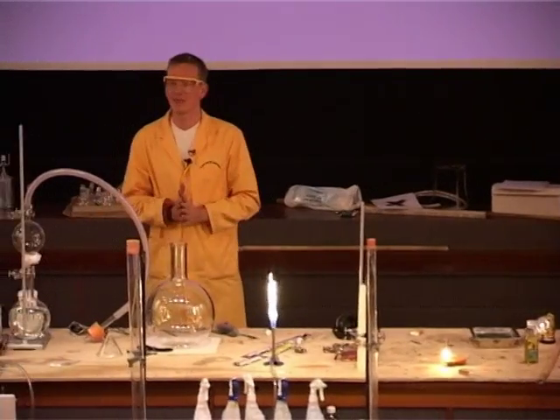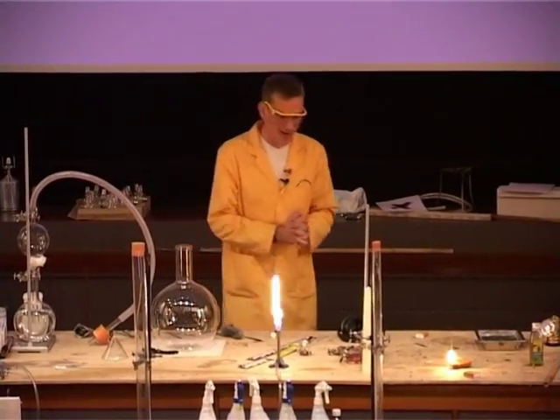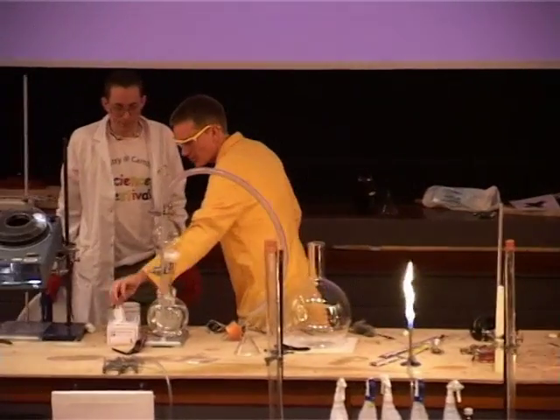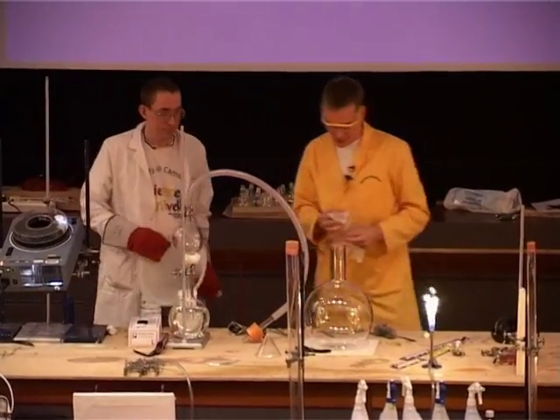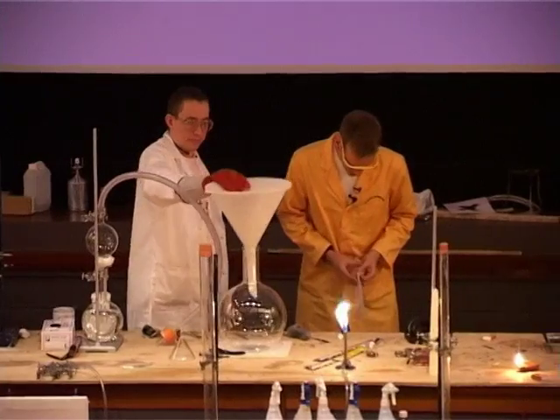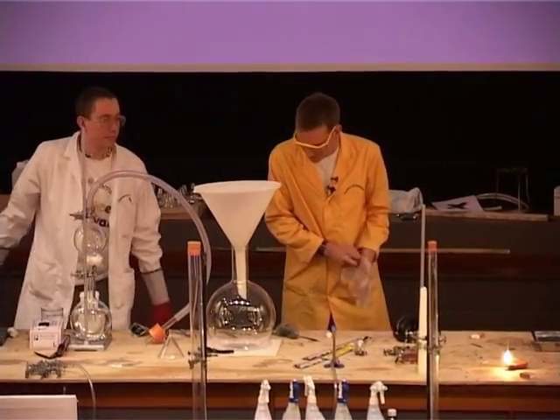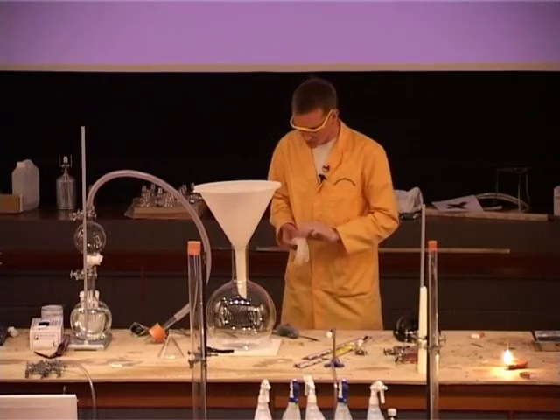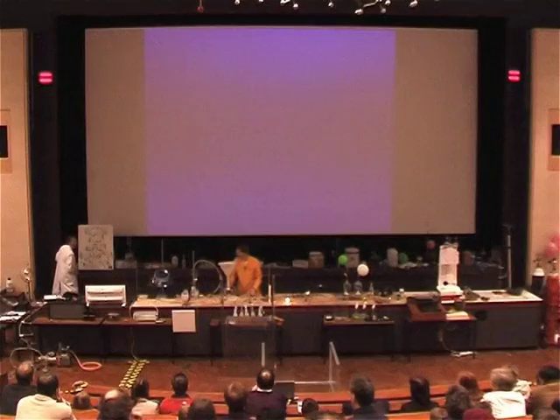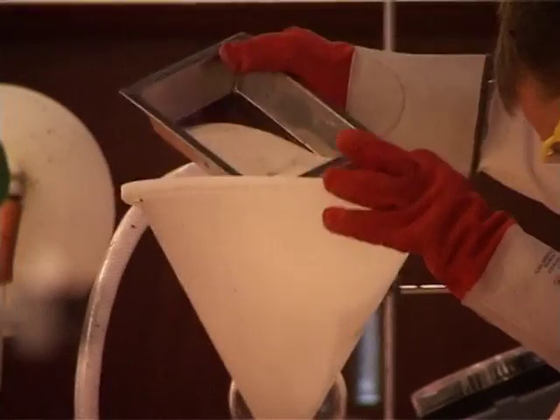I thought we ought to demonstrate this to just show you how reactive phosphorus really is. I'm going to get some phosphorus in a second. It's really rather unpleasant stuff, so I need to put on my gloves here. And Mark is going to bring some warm sand — we've had some sand warming up just in the corner there.